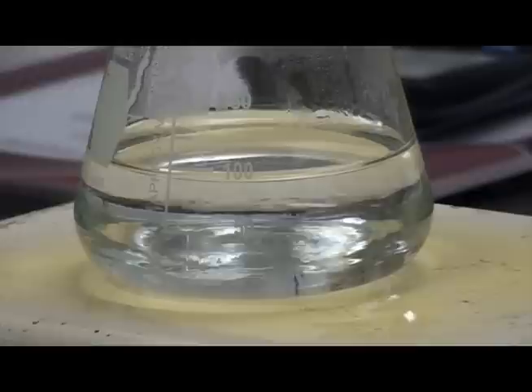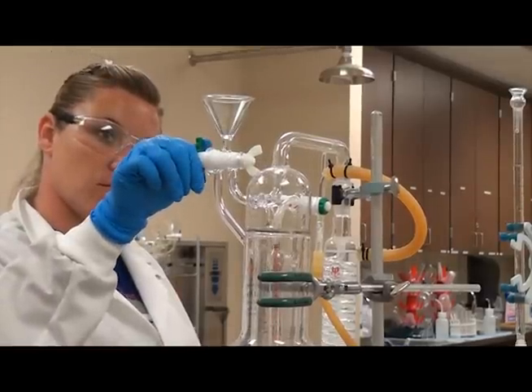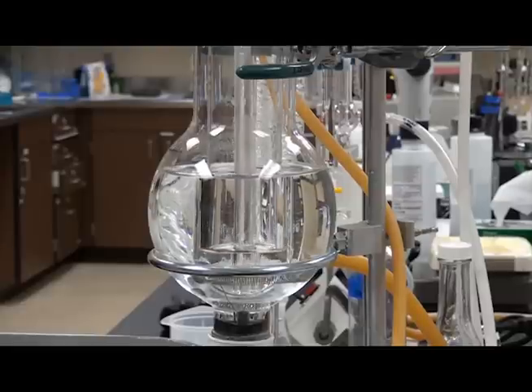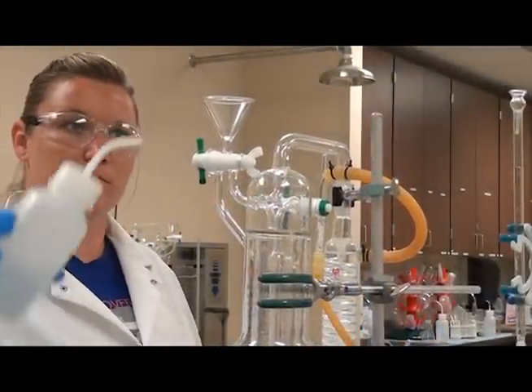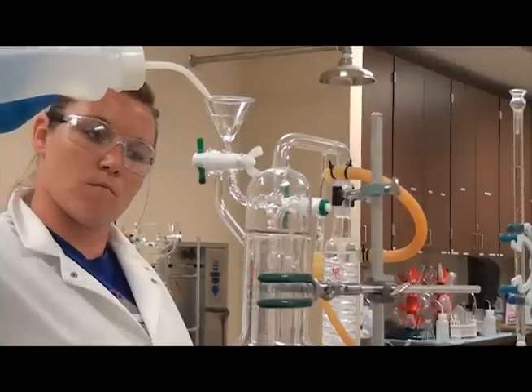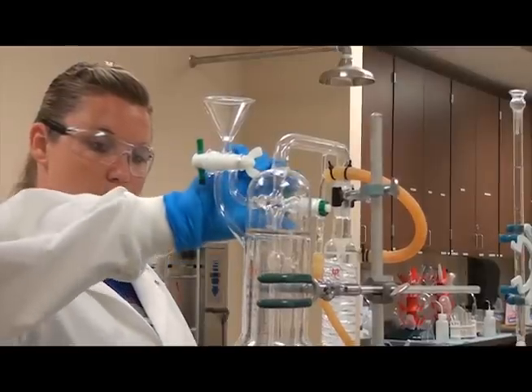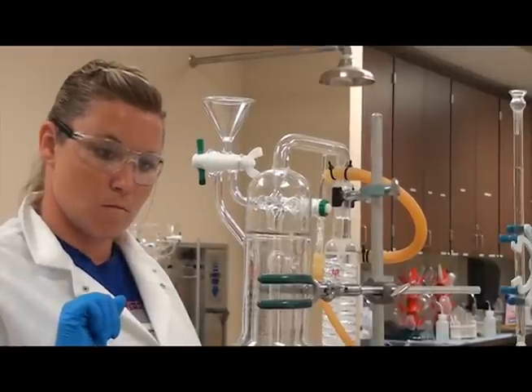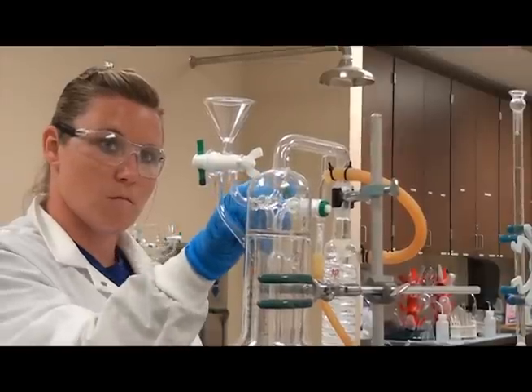Using the hot plate, heat the sample for about two minutes or until it's warm to the touch. While the sample is heating, aspirate the sample chamber. Open the aspirator stopcock B and suck out the sample chamber by turning it horizontal. Return the stopcock to the vertical position. Rinse the sample chamber three times with DI water by turning the stopcock A with the green knob up. Use stopcock B to aspirate the sample chamber. Refill the outer bowl with DI water. Put the knob A with the black up and add the DI water. This will need to be done after each sample is run. Refill the outer chamber with DI water.